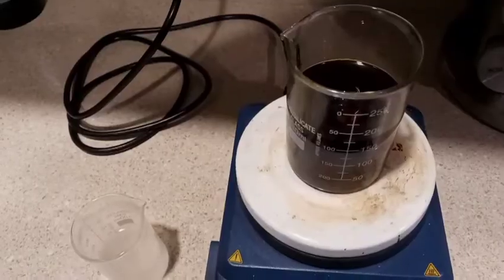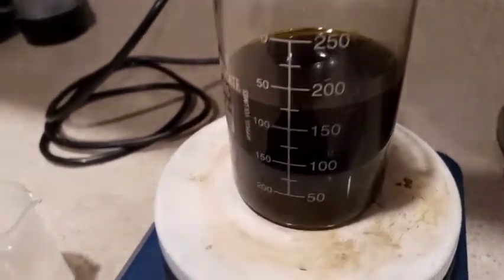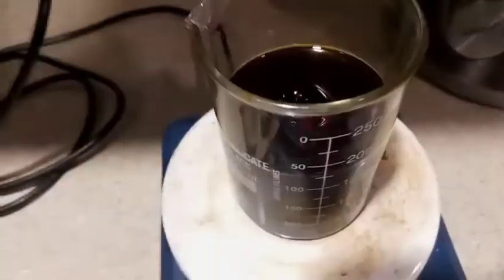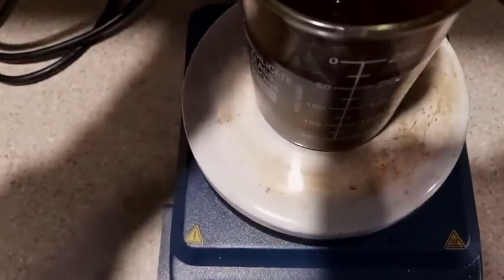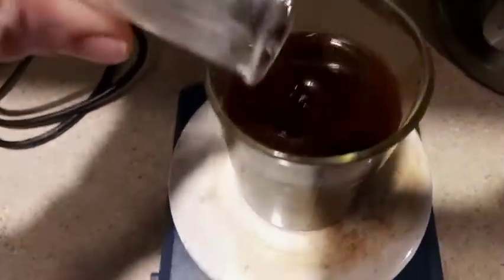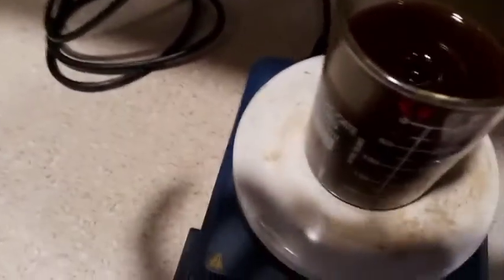You can actually see some of the oils coming out. We finally got it filtered and evaporated down. I started seeing what I thought might be crystals, so I figured why not get the next step started — the black pepper extract in ethanol and then the 6 grams of potassium hydroxide in ethanol. Adding it now. We'll let that stir for about five minutes, get the filter set up, and all the little soaps made from this reaction will be pulled out.